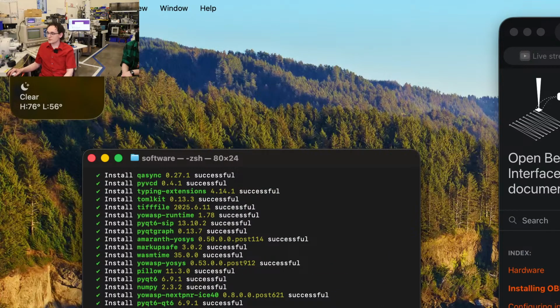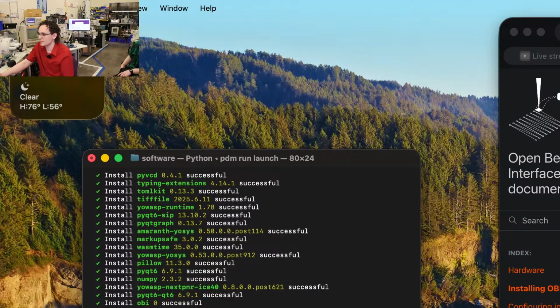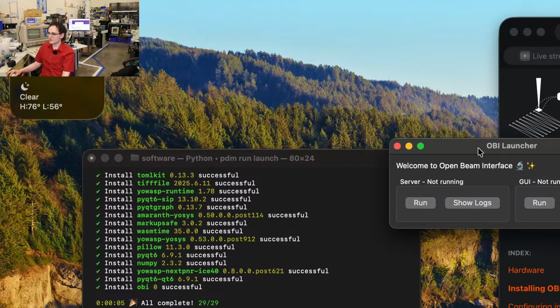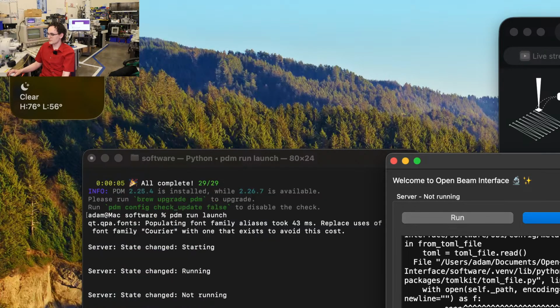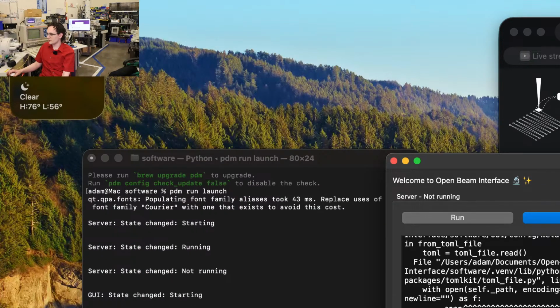You don't have to, but you can use an existing Glasgow installation. But right now, we are just letting the OpenBeam interface take care of our Glasgow. So now that we have that installed, we're going to do PDM run launch. And launch is something that is set up for OpenBeam interface that will launch this window right here. And this lets us run the OpenBeam interface server and run the OpenBeam interface GUI.